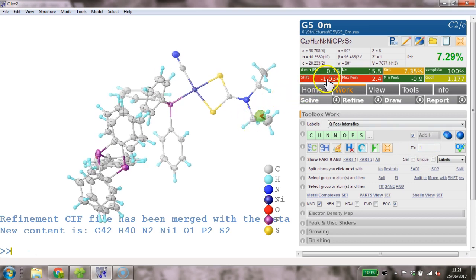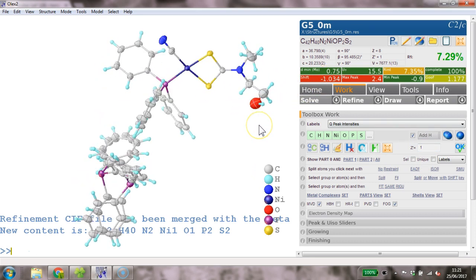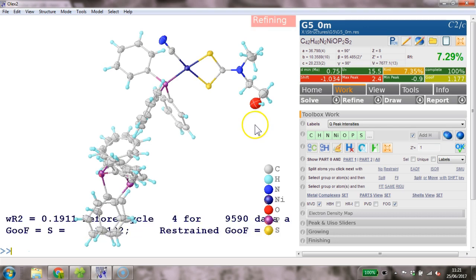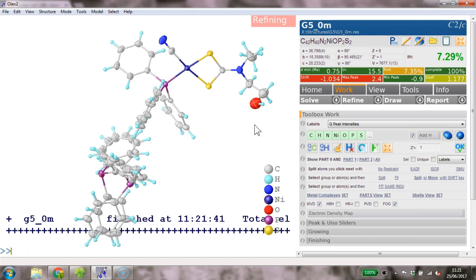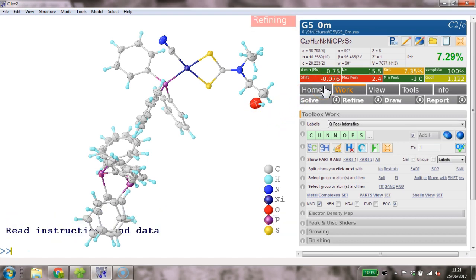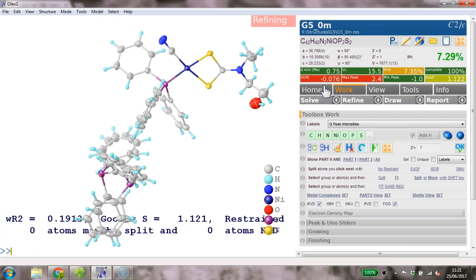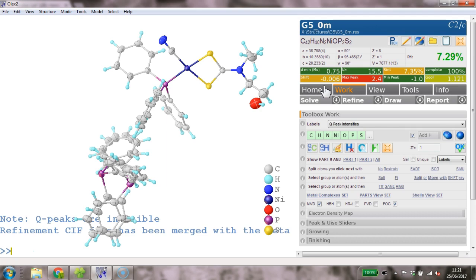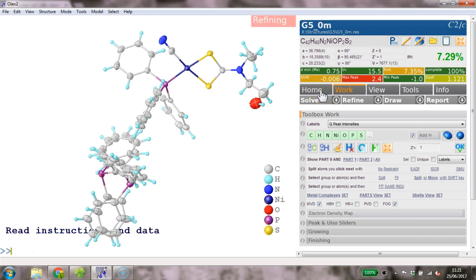What's moving about? It's the Ueq of that oxygen. So something is going on. I don't know whether it's worth dealing with it though. Let's see whether it settles. It looks like it is settling down. If it does settle, I would leave it at that. Yep, it's settling nicely. One last cycle.